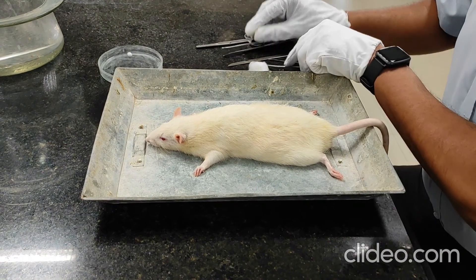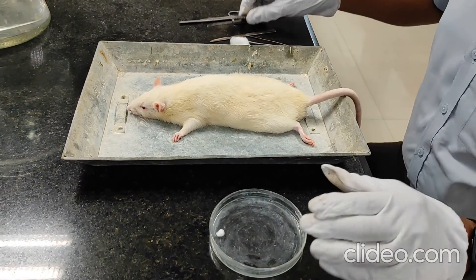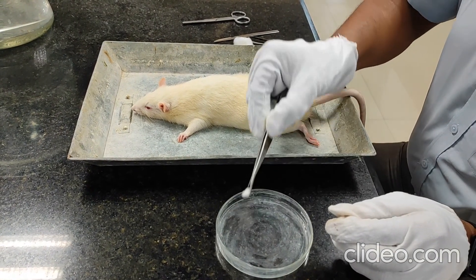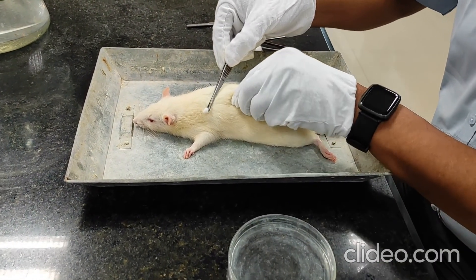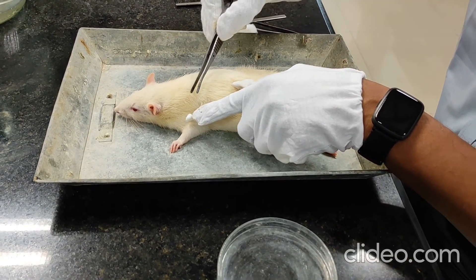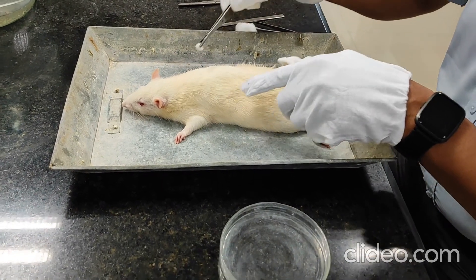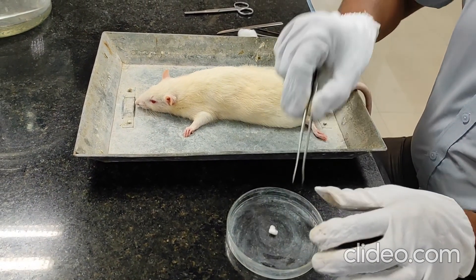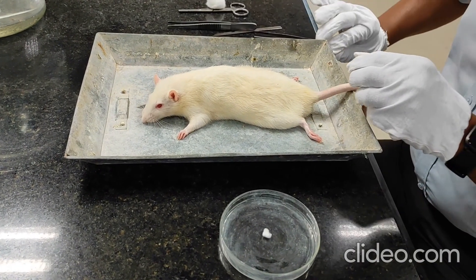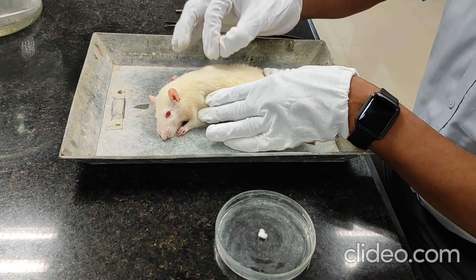Then take a sterile cotton pellet and insert it into the subcutaneous pouch. On both sides you can place the cotton pellets. Then use a surgical thread to suture this part.